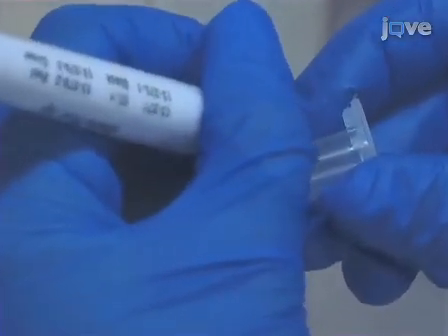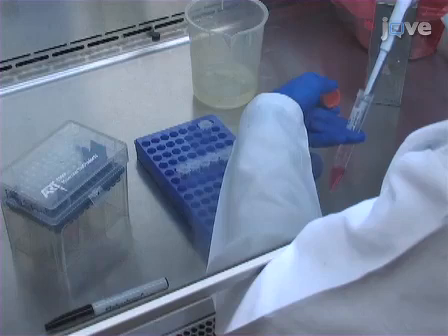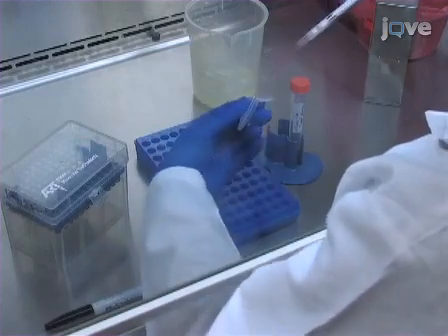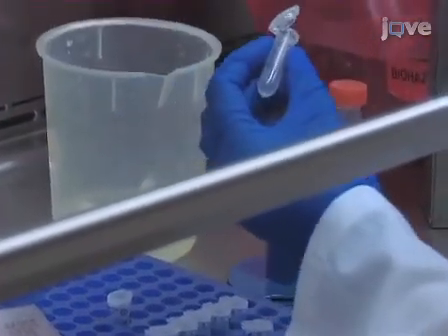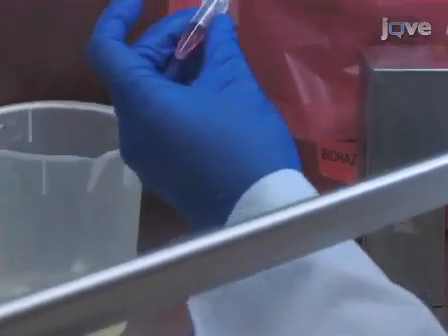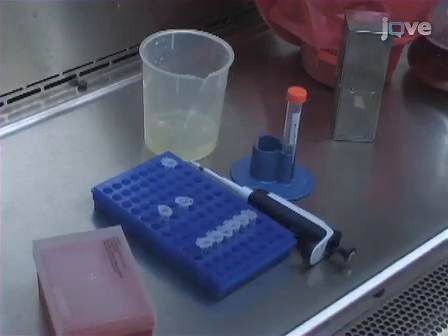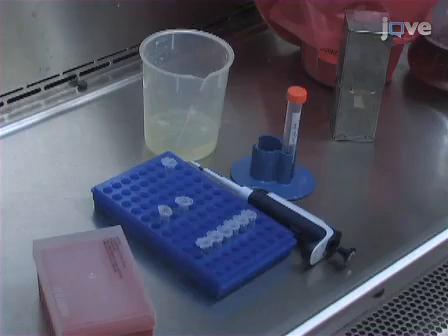Label a set of tubes with each chondroitin sulfate and polybrene polymer concentration to be tested, then aliquot enough of the viral suspension for each condition in triplicate into the tubes. Next, pipette the required volume of chondroitin sulfate and polybrene stock solution to make up the test concentrations into each of the tubes in succession. Immediately after the addition of chondroitin sulfate and polybrene, flick the tube to mix. Allow the virus chondroitin sulfate polybrene mixtures to incubate at room temperature for 5 minutes. The mixture may become cloudy as viral precipitates form.